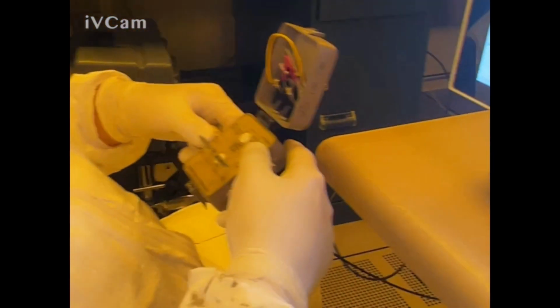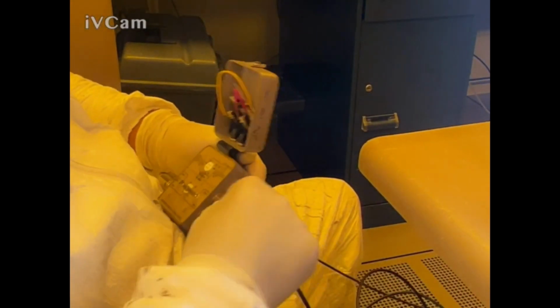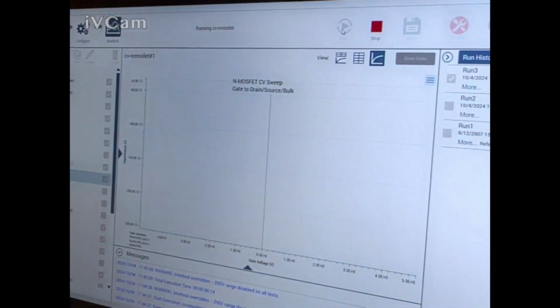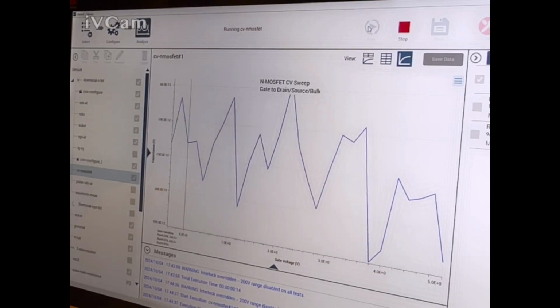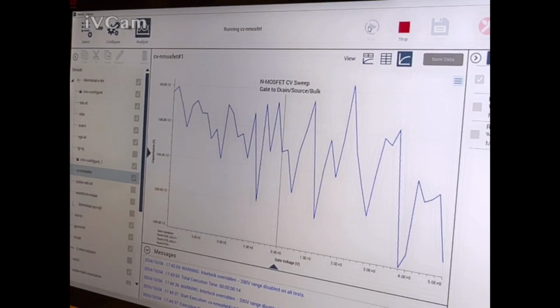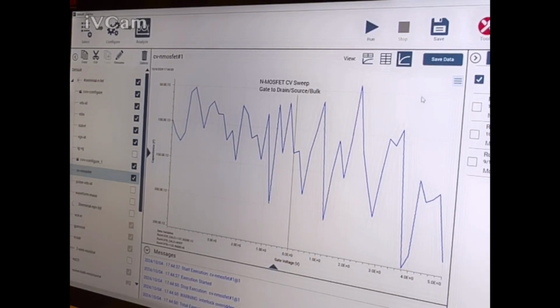So I should be moving which way? Let's move the source over. I moved the wrong cable. Let's try that. So I disconnected the gate. We need the gate. Something doesn't look right. No, that's not right. Something's not right here. Maybe I need that fourth cable. That might be the problem.